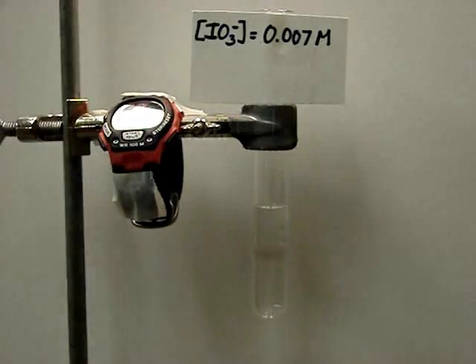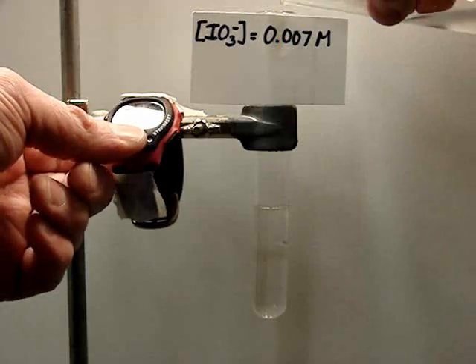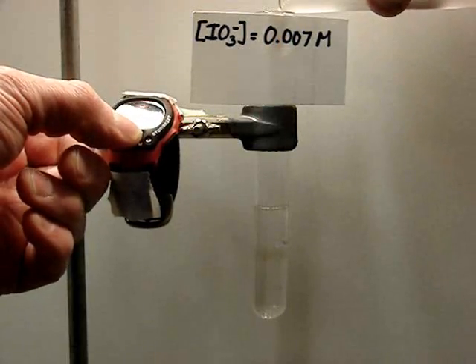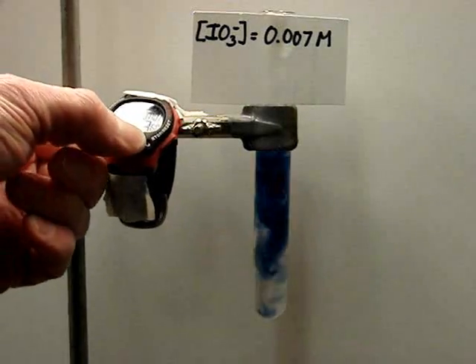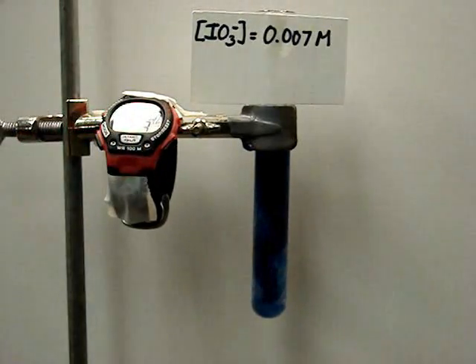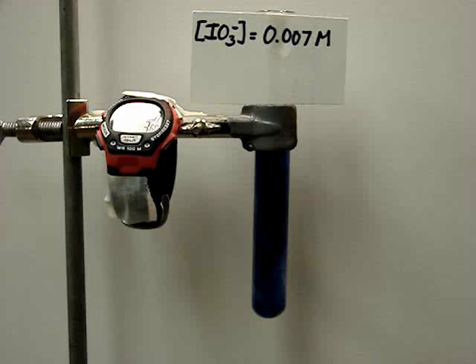Now try 0.007 molar. About 3.68 seconds.